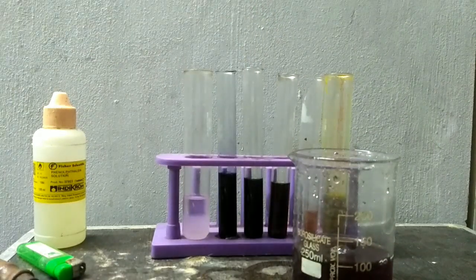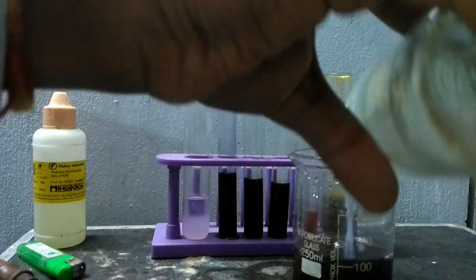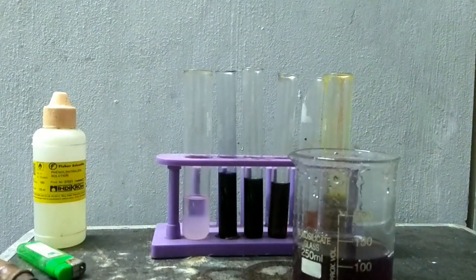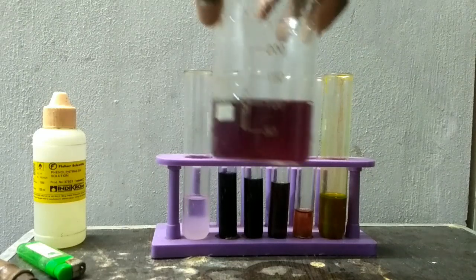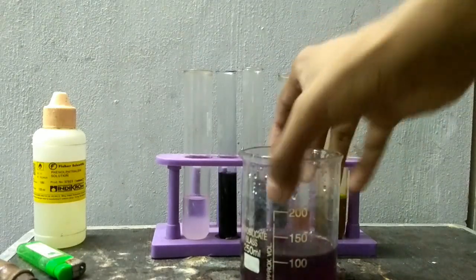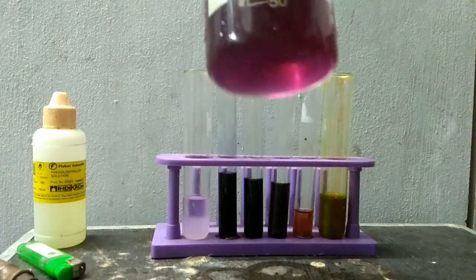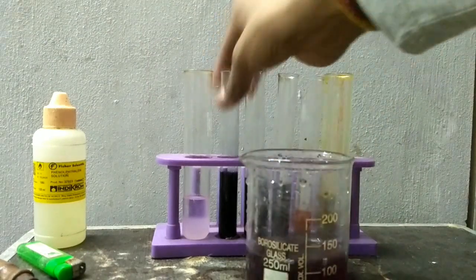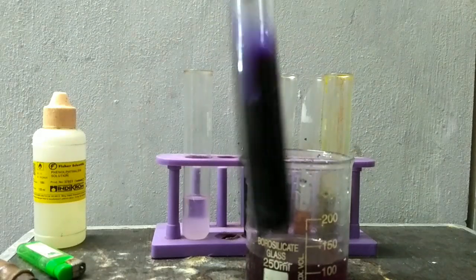Let's add sodium hydroxide to the solution in the beaker. On adding sodium hydroxide, the solution has become purple. This is the highly alkaline one.